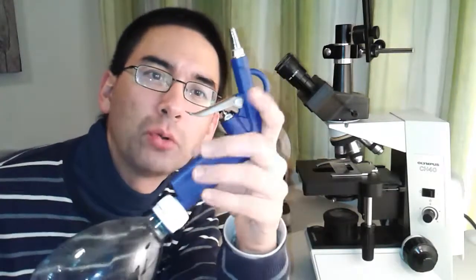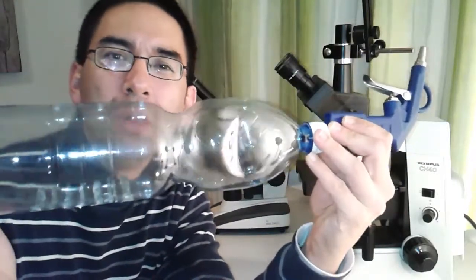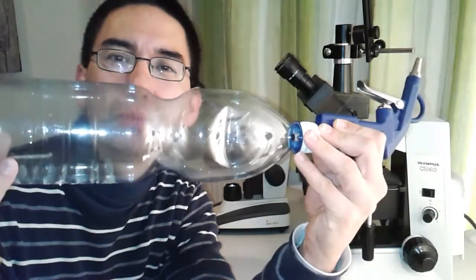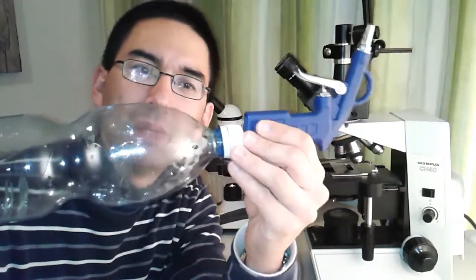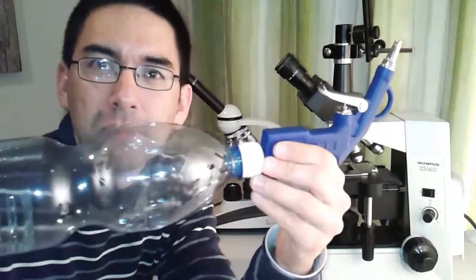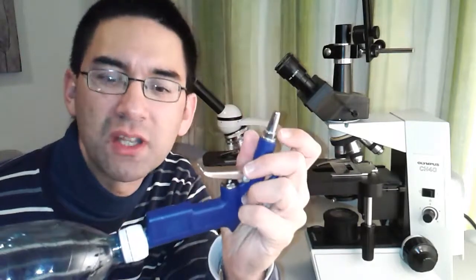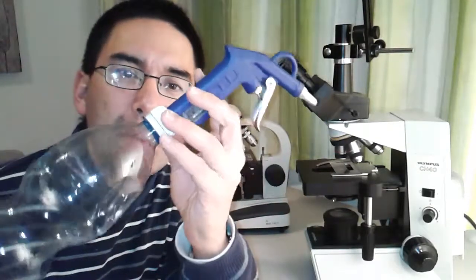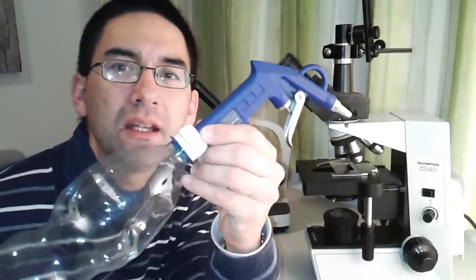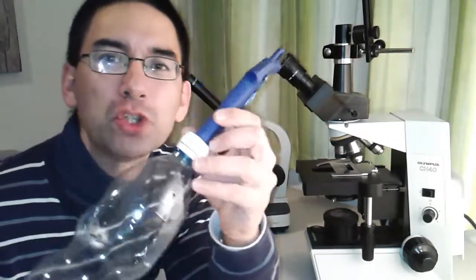All you need is this air blow gun. Very cheap. I bought this from a local hardware shop, but you can also buy this online, of course. And then a plastic bottle. I probably would use a bigger one right now, because then more compressed air can be contained, and it lasts longer. You fill it up with a bicycle pump, and then you are able to use it for a couple of seconds. But the air speed is fast enough to really remove dust. The most difficult thing was connecting the air gun to the cap here, to make it airtight. This was really a headache, and I tried several possibilities, but this one luckily could be screwed on, so it's airtight right now. Okay, but I'm going to show you now how I actually made this.